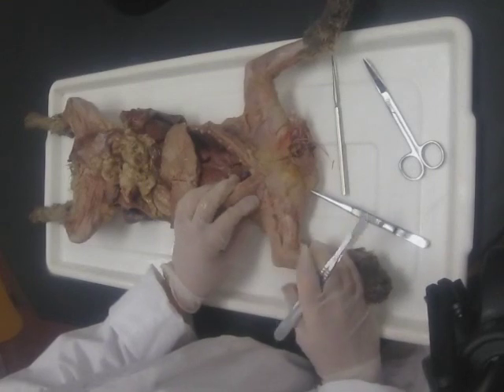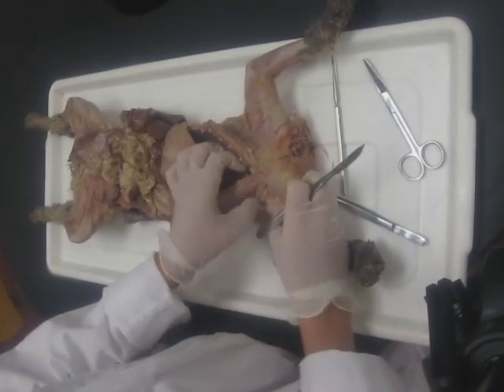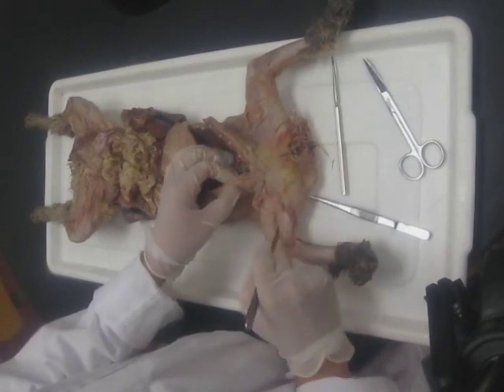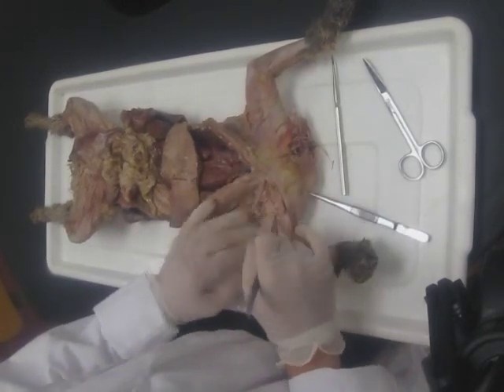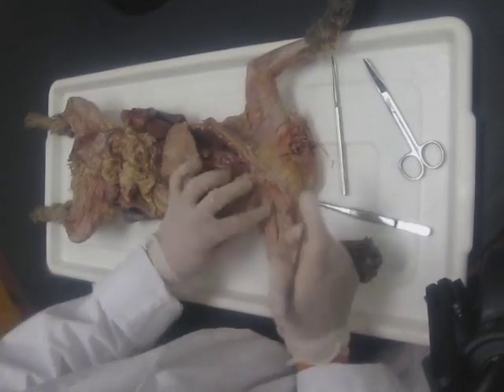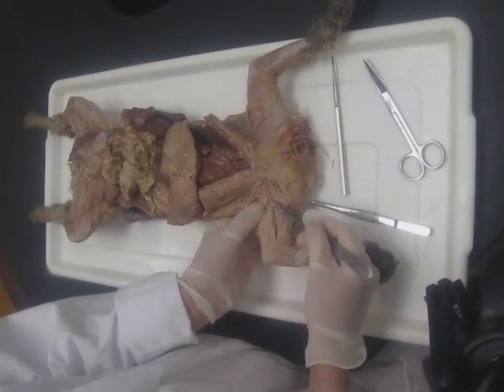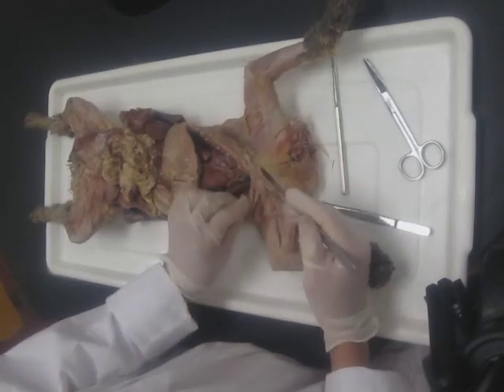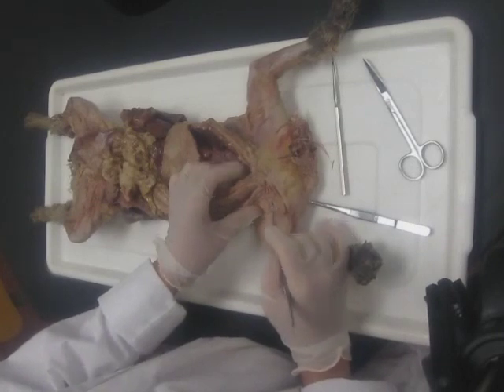Make sure that you're not cutting off any important vessels. Light incision, separate the muscle — repeat that process. Now you can see a blue vessel down here; those are going to be our veins. Veins are more superficial than arteries, so you're going to see them first.